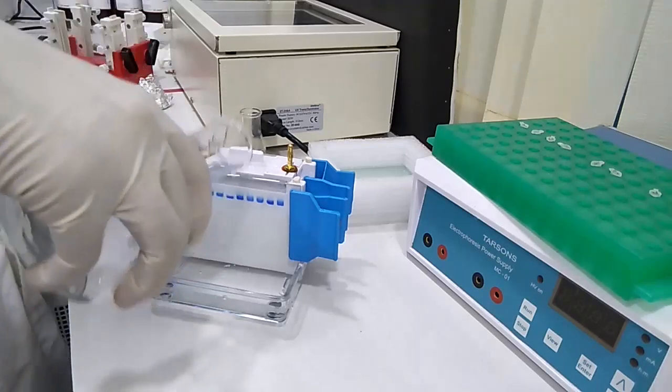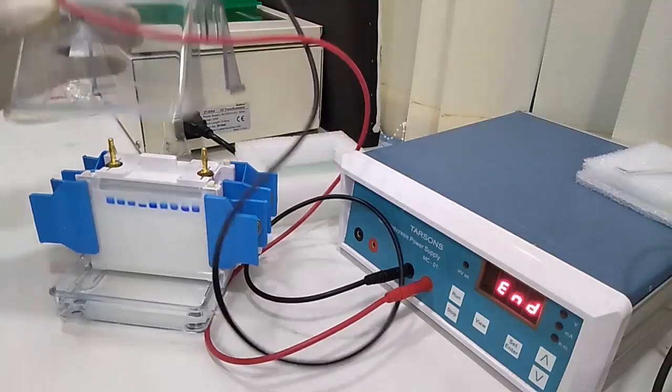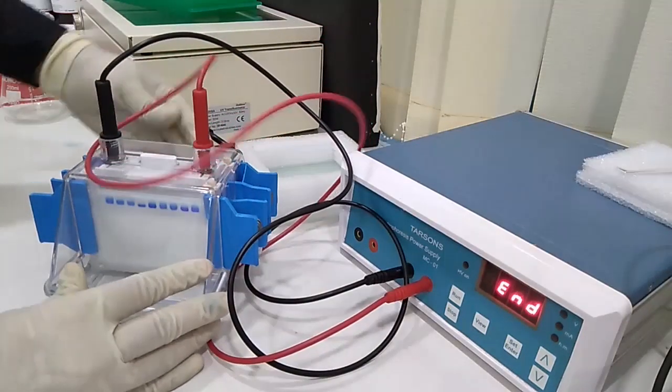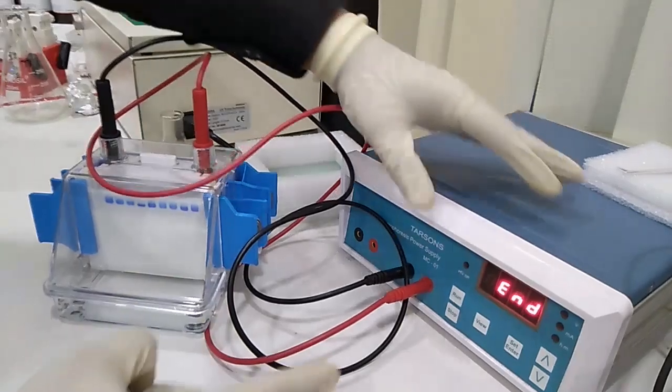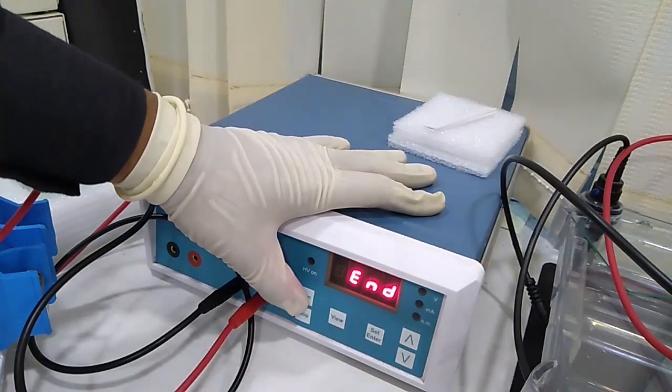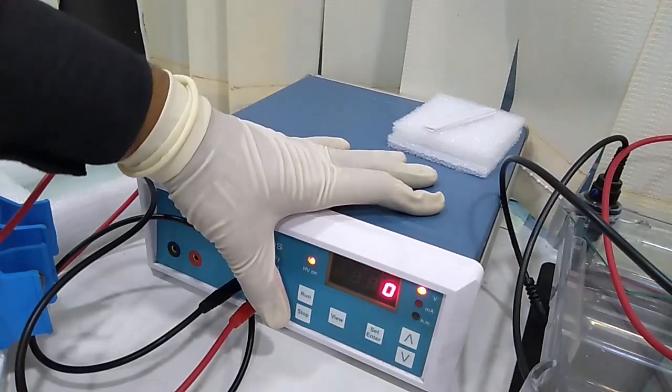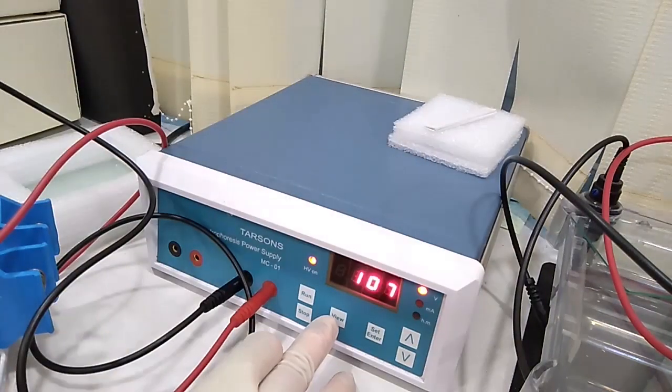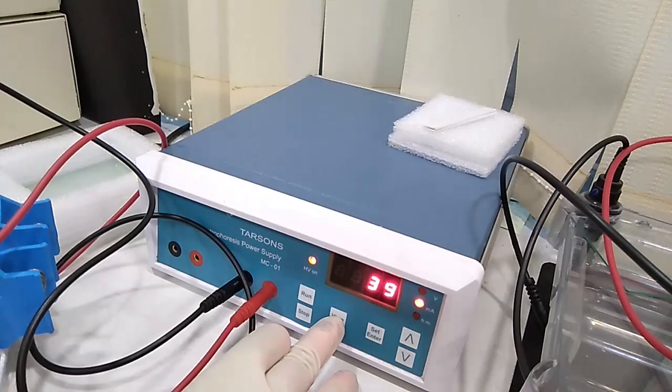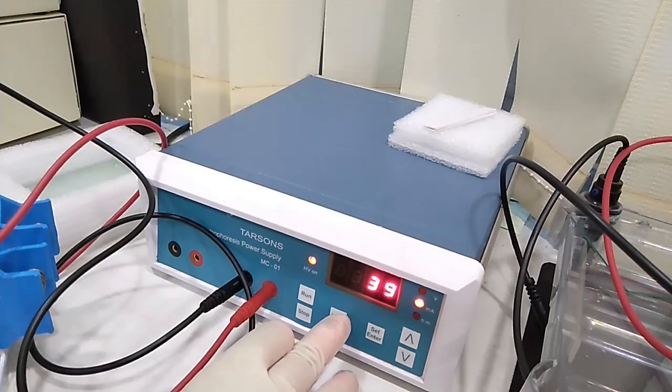The buffer is loaded. Now covering the lid. Now we are running the sample. Now you can see we are running it in 125 volt into 40mA.